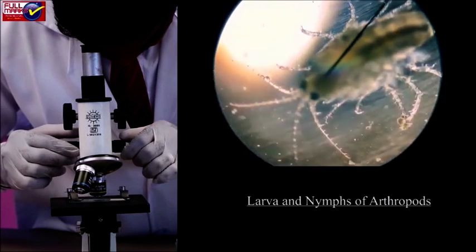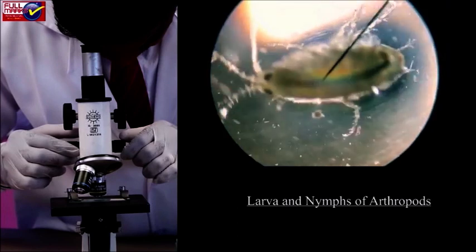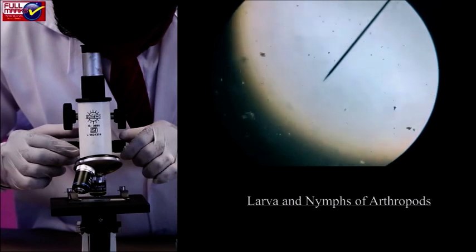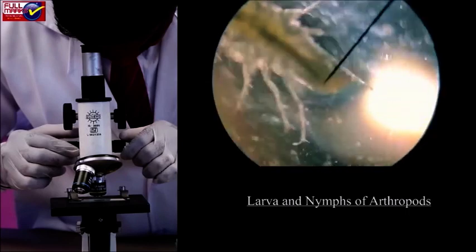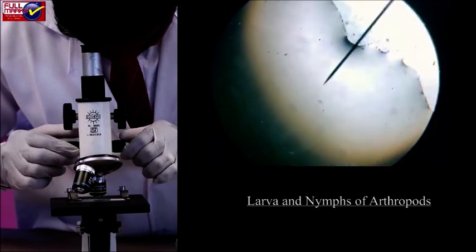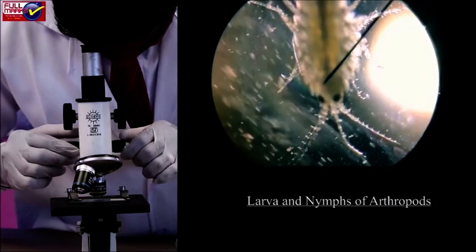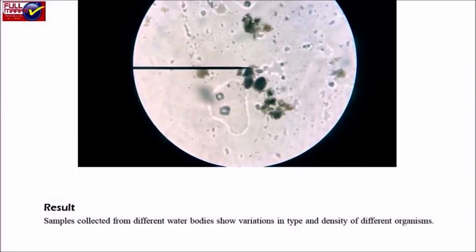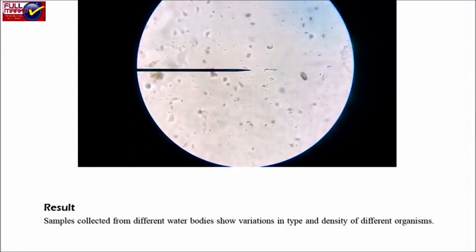Larvae and nymphs of arthropods. Larval and nymph stages of various insects are found in most of the water bodies. A few of them are shown in the figures below: amphipod, mosquito larva, isopods, Dytiscus larva, Dytiscus, water scorpion, first instar mayfly nymph, second instar mayfly nymph, instar nymphs of dragonfly. Result: samples collected from different water bodies show variations in type and density of different organisms.